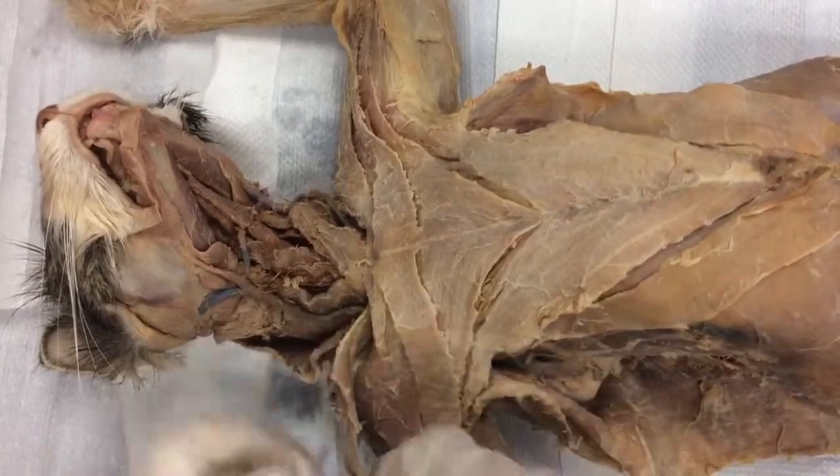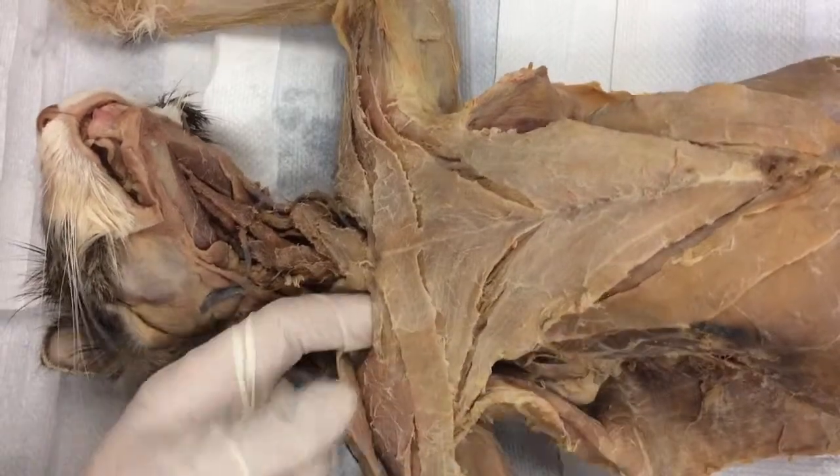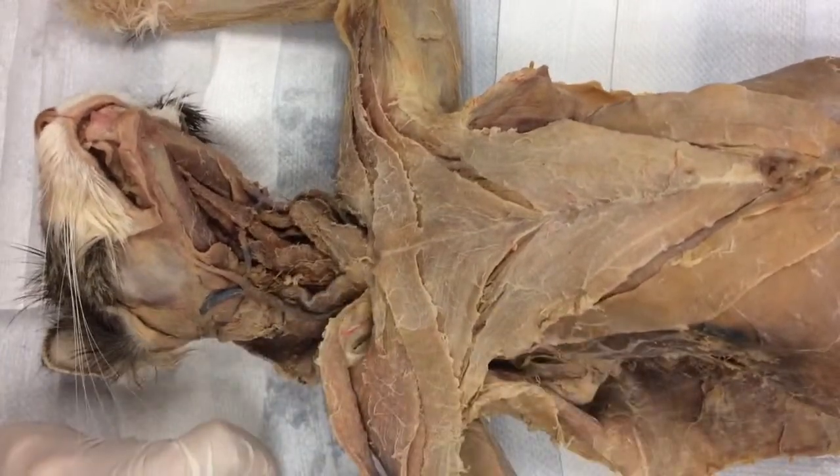So that is clavobrachialis — easy part. And then disconnect the clavicle and produce that big pothole right there.